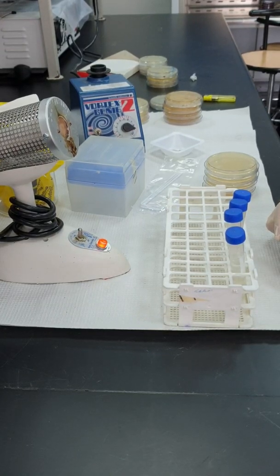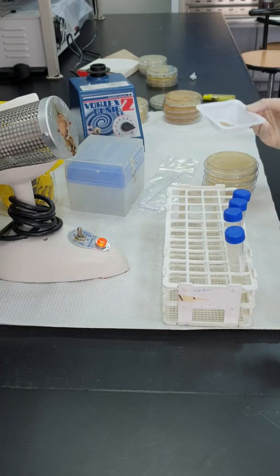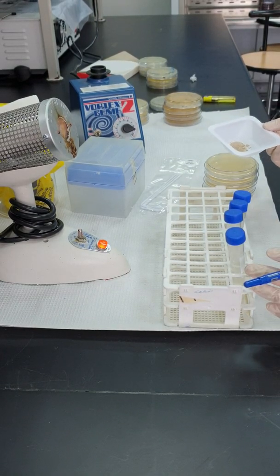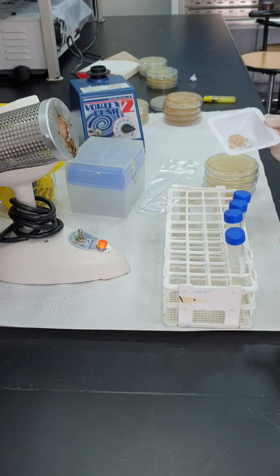In this video, I will show you the spread plate method. Spread plate method is a dilution method that helps you to answer the question, how many bacterial cells do you have per ml of a sample or per gram of a sample? The sample that I have chosen for you is soil.